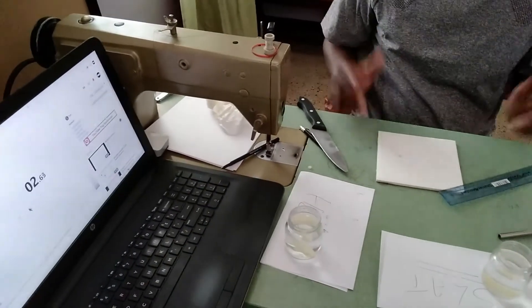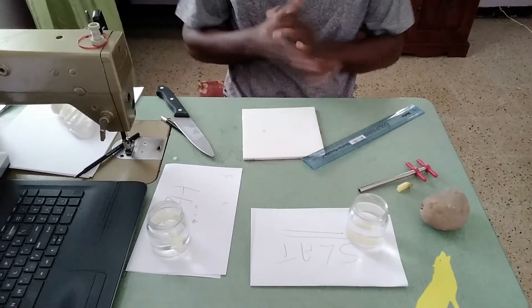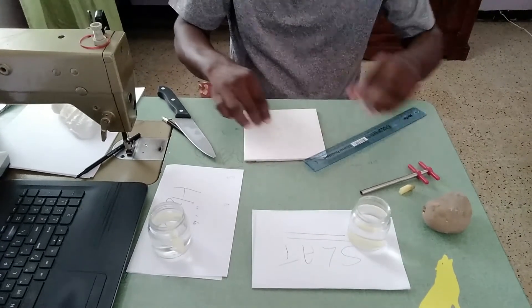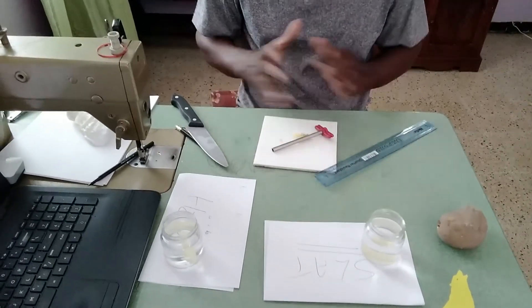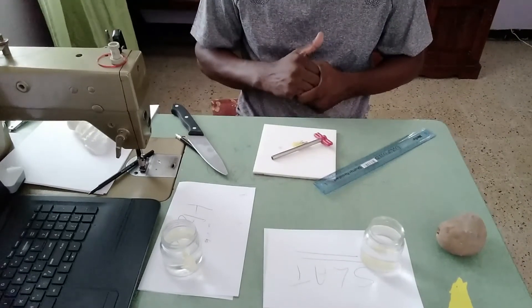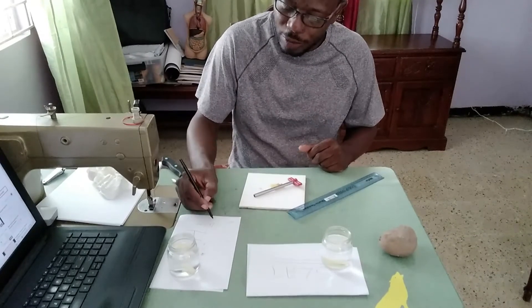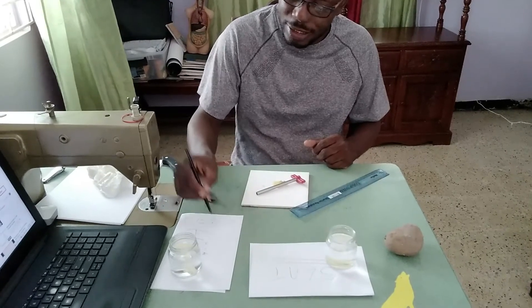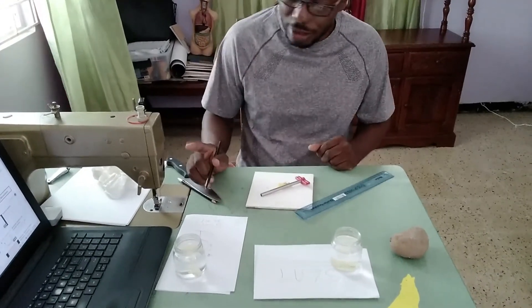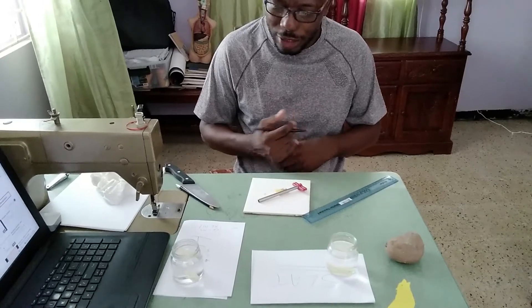Here we go — starting the time. The small time lost between immersing both strips is not too significant, but when working in groups at school try to start both at the same time. We're going to be timing this and show you the result. Remember we are using a potato length of 4 cm, the volume of water is 86 ml — all of this is start information. We're going to be waiting and then see what the end result will be for both strips of potato.